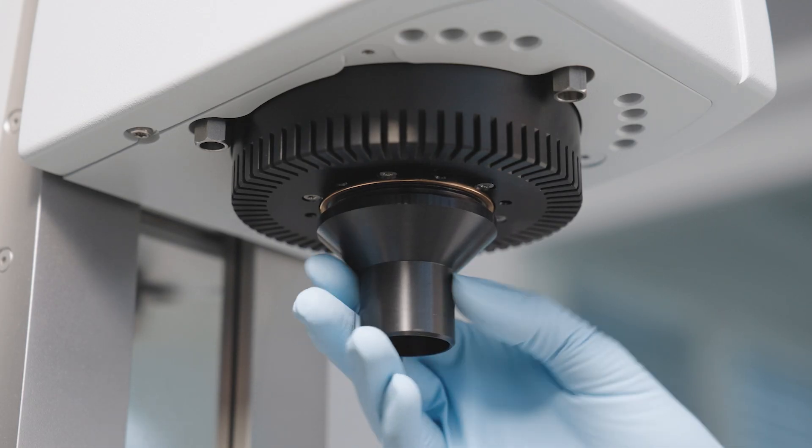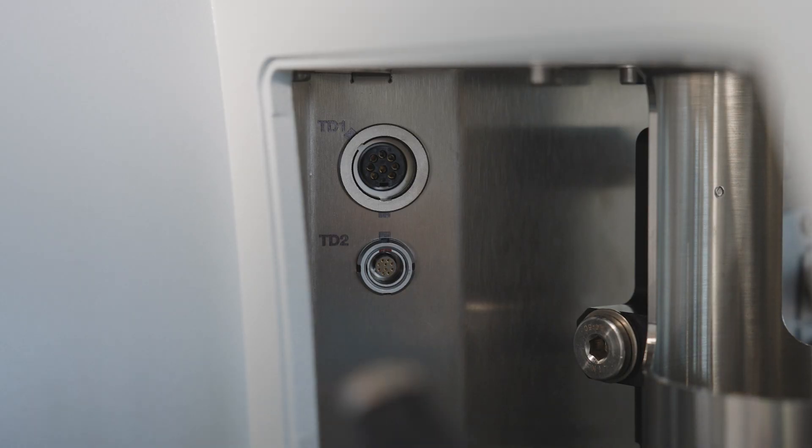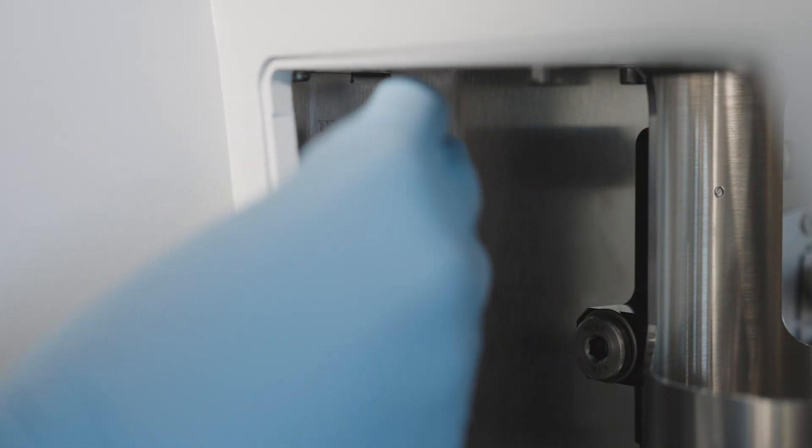Remove the coupling protection and the two side covers of the device. Plug the dongle into the TD-1 connector for automatic measurement cell detection.